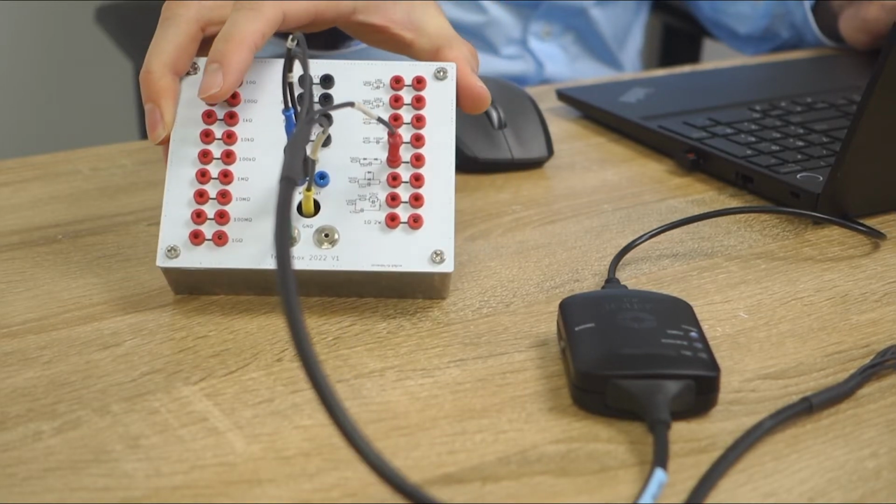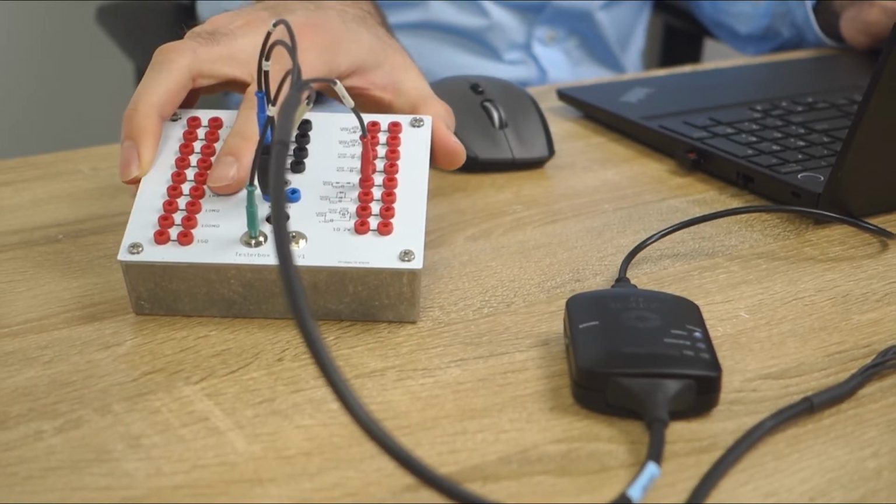We're going to be using this little box over here, which we're just using as a test cell. So this emulates your chemistry, but it's just electronics. For most of the measurements, we're going to be using the redox sensor, which is also available on the dummy cell, the little blue PCB that is also supplied with most of our instruments. For those who have the dummy cell in front of you, that's the WEA. The reason we're using this is because if you do an SWV on this dummy cell, then you get a nice peak, and it's going to become important later that we have that peak.